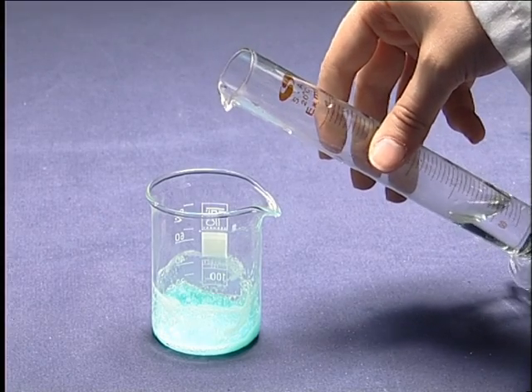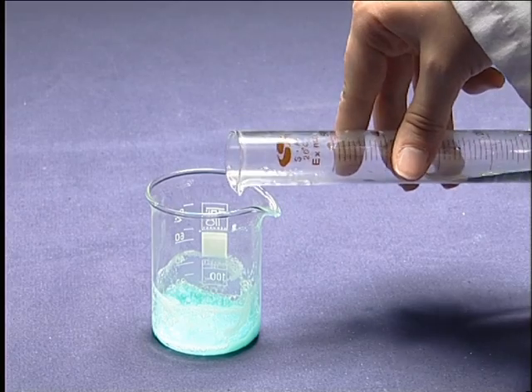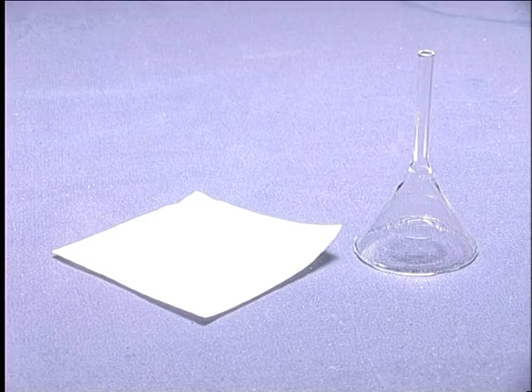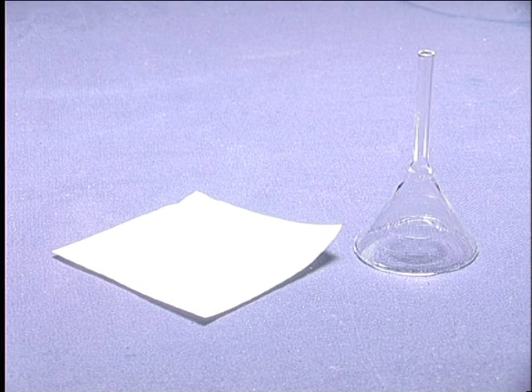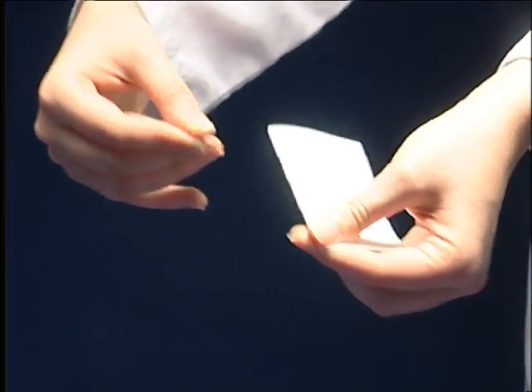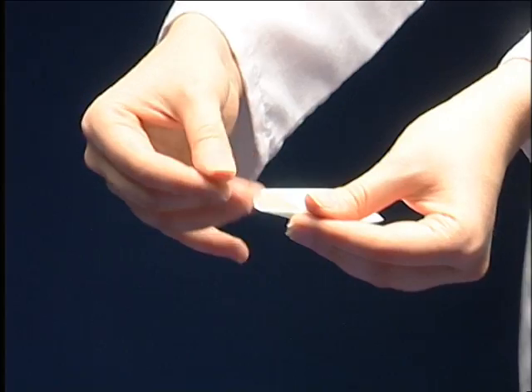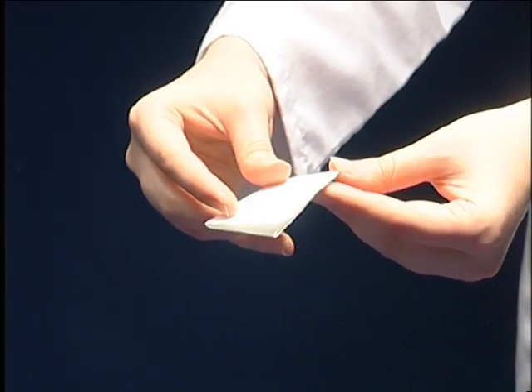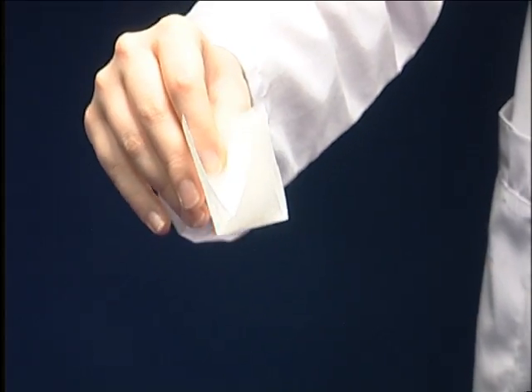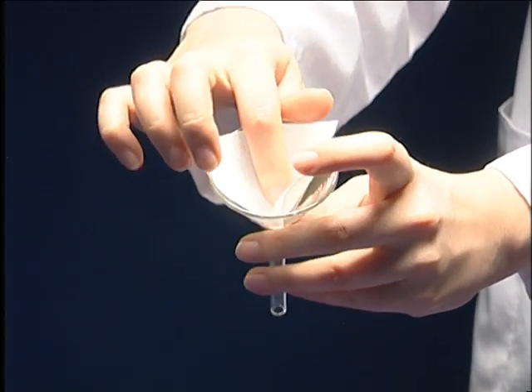Add water to the completely solidified mixture. Filter paper and funnel will be used. Fold filter paper into 4 parts and place it into the funnel.